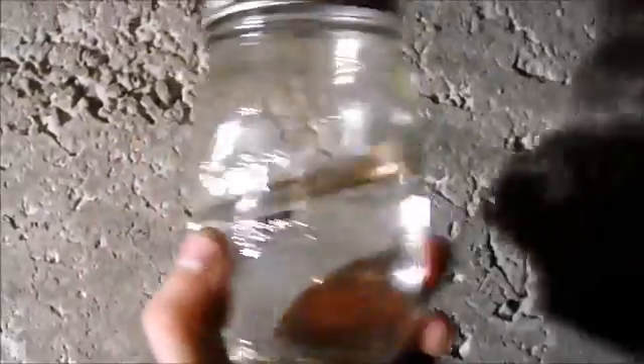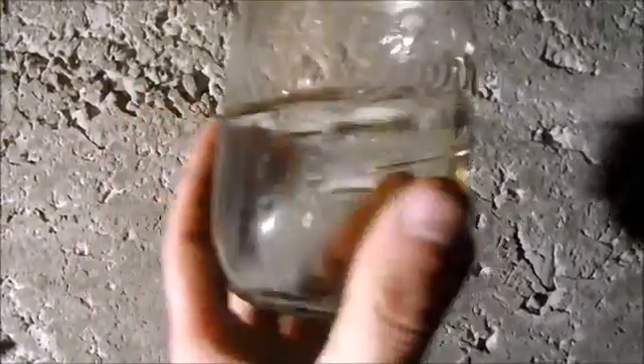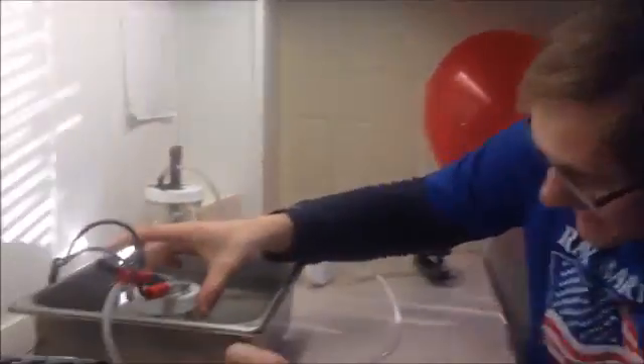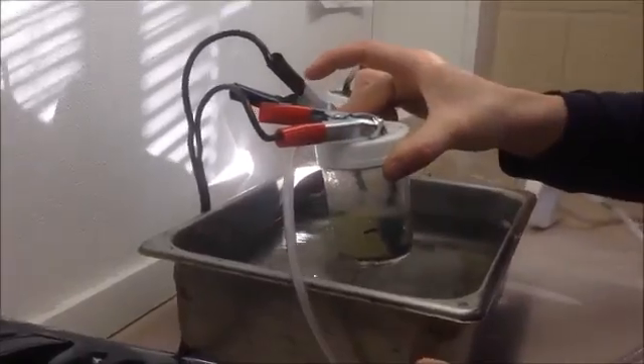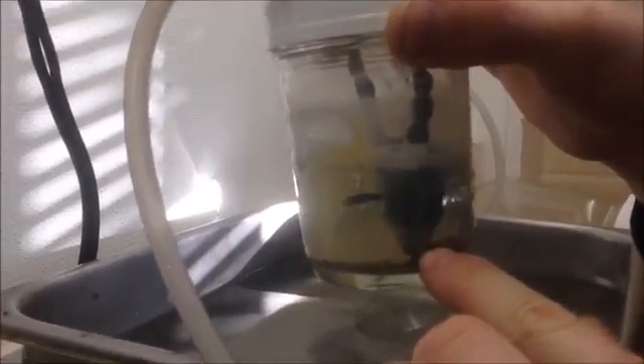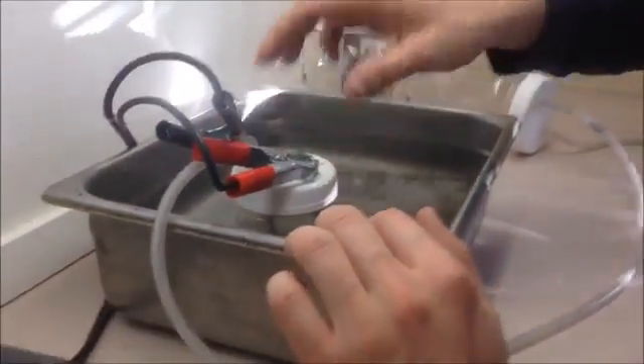I got all the magnesium out. Looks like I've got about 300 milliliters left. I guess it's time for my $60 sulfuric acid — I'm only going to add a little bit. I've got this set up here in a small jar with some lead wire going in there. You can see it's bubbling fiercely. It's also getting quite hot, so this water bath is definitely helping.